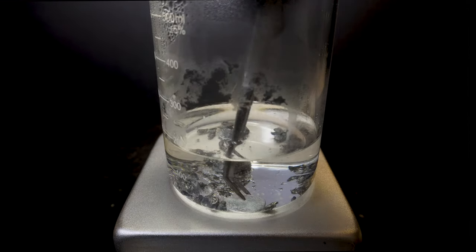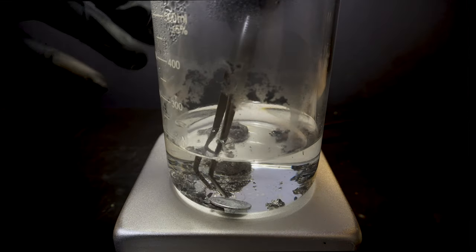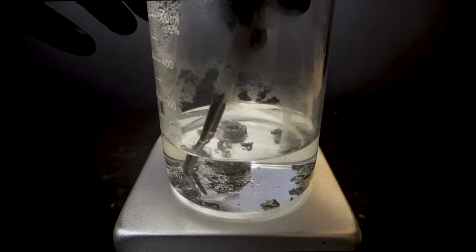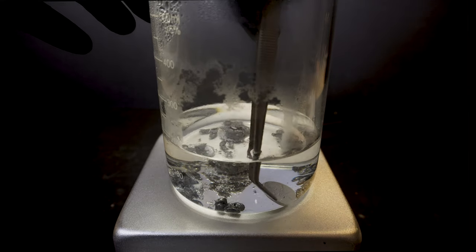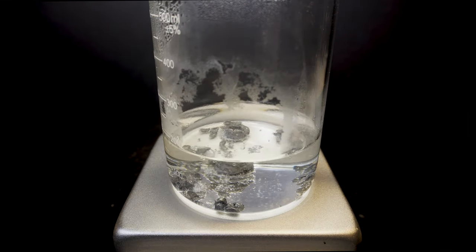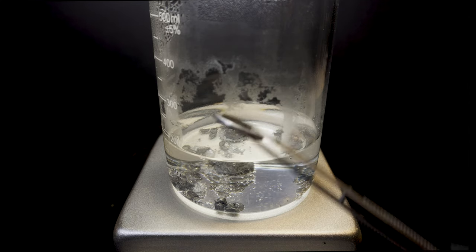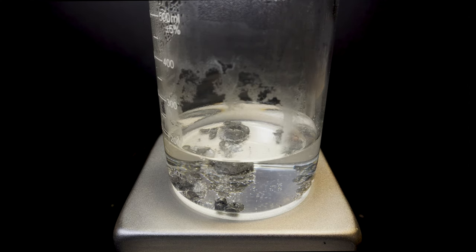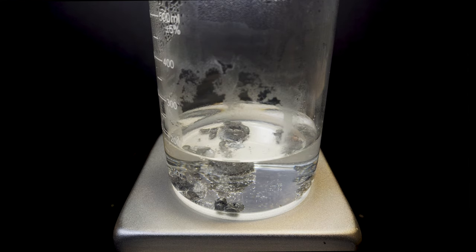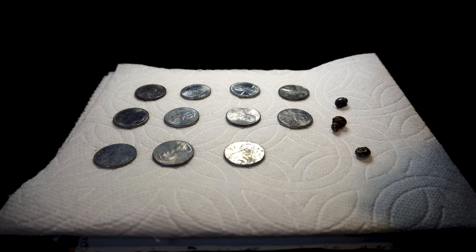What is actually happening here is the zinc and copper are starting to trade electrons with each other and they are chemically bonding under these conditions. When I take each penny out for the final time I dunk it in distilled water to cool it down and remove any excess particles. Following this I place them on a paper towel and allow them to dry.